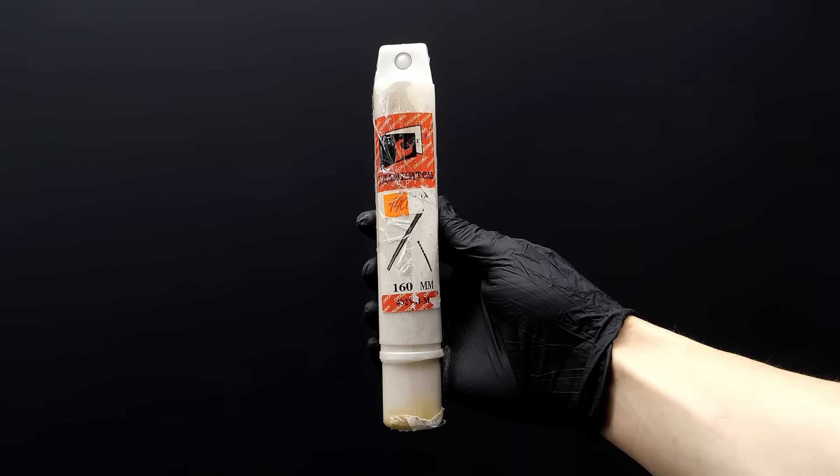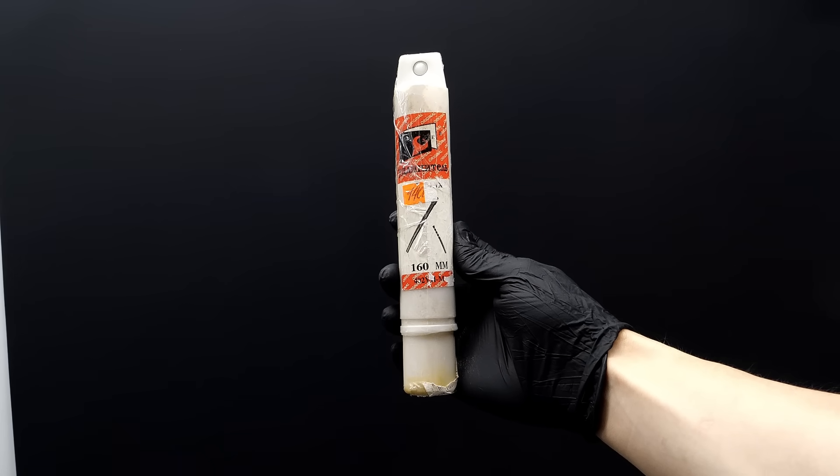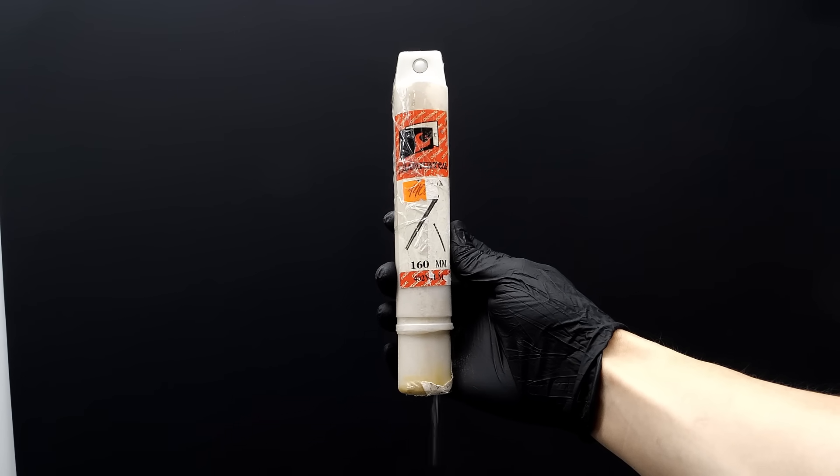A while ago, I bought this little tube from Russia, and I think it's finally time to crack it open.